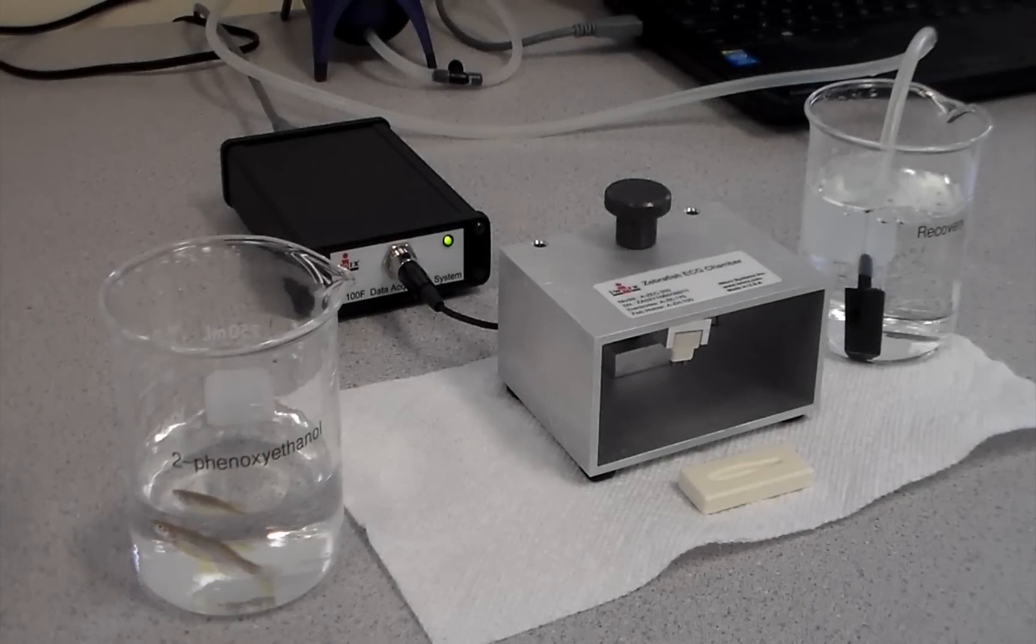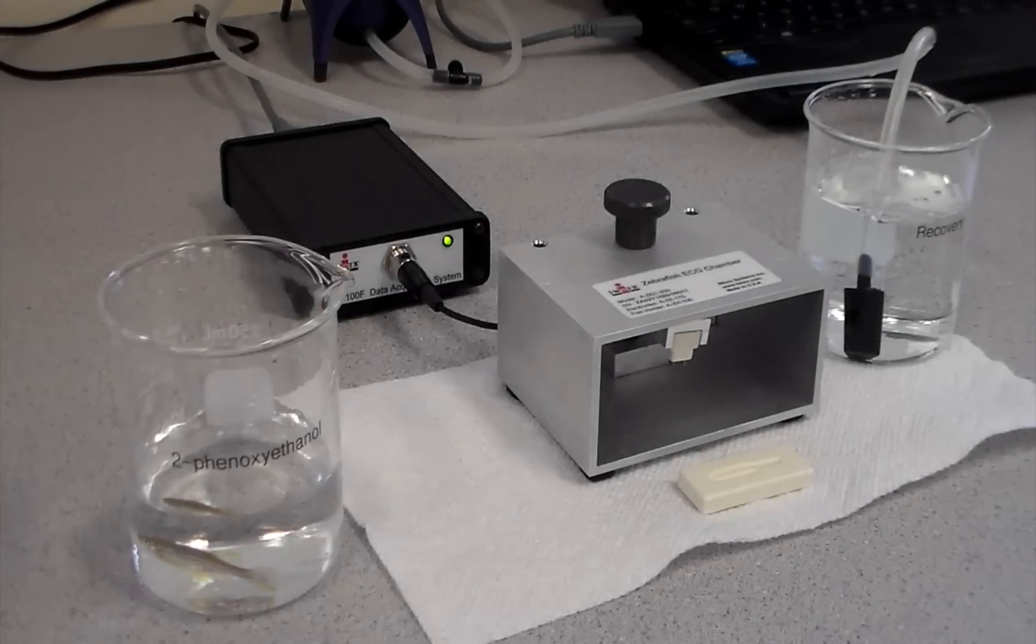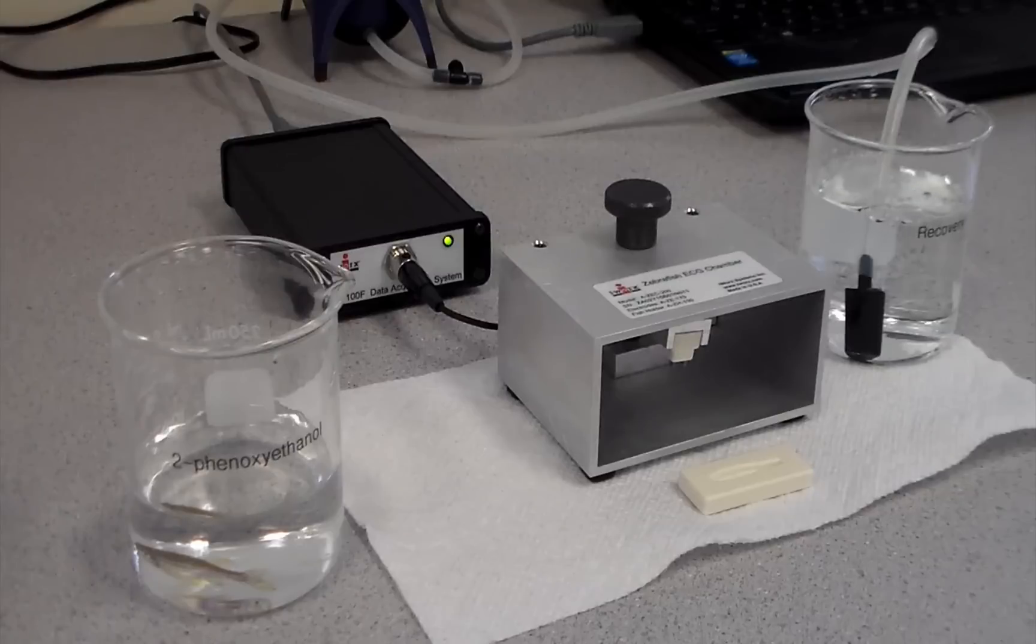Getting back to our fish, it's pretty much out, and now is ready for the experiment.